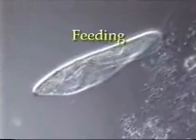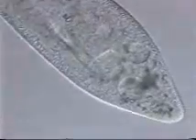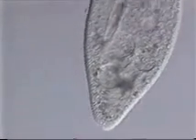Observing Paramecium under higher magnification shows what it eats and how the food is digested. Along one side, the cell has a channel, the oral groove, ending in a cytostome, the cell mouth. Here, bacteria are funneled into a short gullet where they are engulfed. Within the vacuole, the bacteria are broken down into their building block molecules, and these are released for use by the cell.